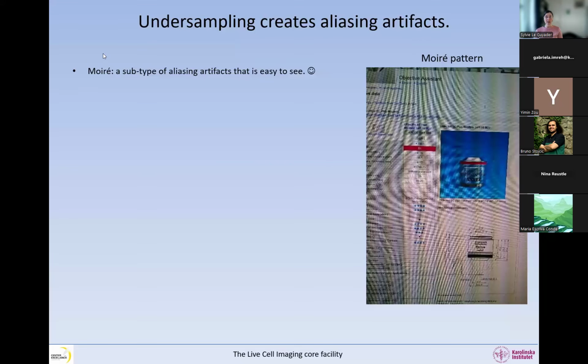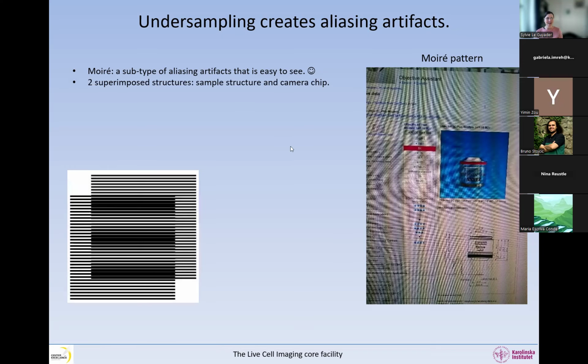So moire artifacts are just a subtype of aliasing artifacts, and they are easy to see. This is the reason why we always talk about moire, just because we can see them. I will try to show you what happens when we do not see moire. If you take a picture of your computer screen with your phone, you will likely see something like this. Moire happens when we have two superimposed repeated structures. For example, a computer screen is a repeated structure, and the camera pixels on our phone are also a repeated structure. So when we have two superimposed structures, the sample structure and the camera chip, then we get moire like this.